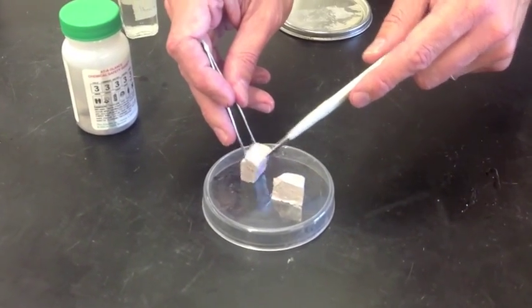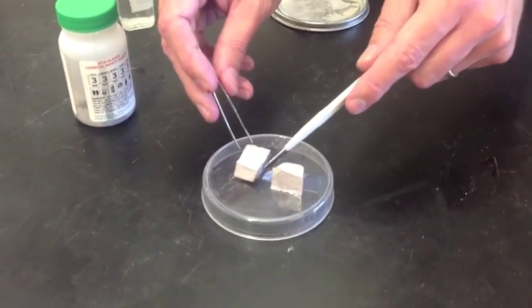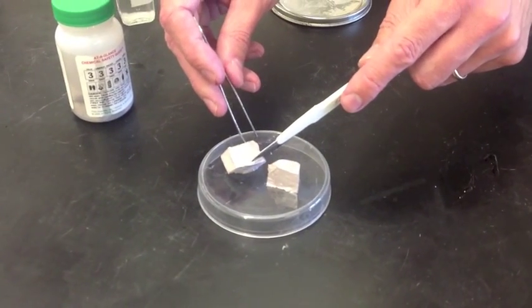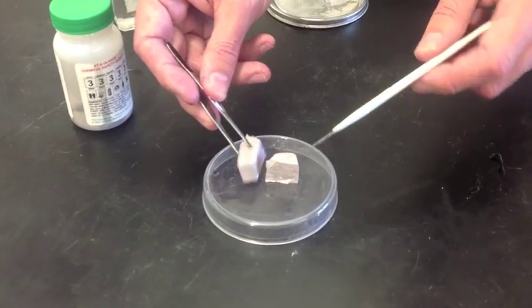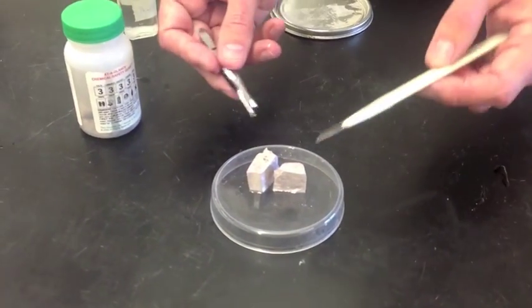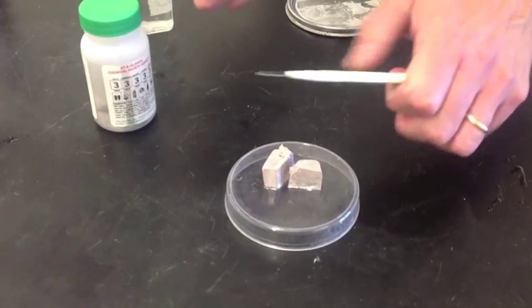It would conduct electricity if we ran wires through it, but we wouldn't want to do that because it would probably catch on fire from the air that it was sitting in. So let's perform this experiment. Let's take a piece of sodium and we're going to dump it into some water.